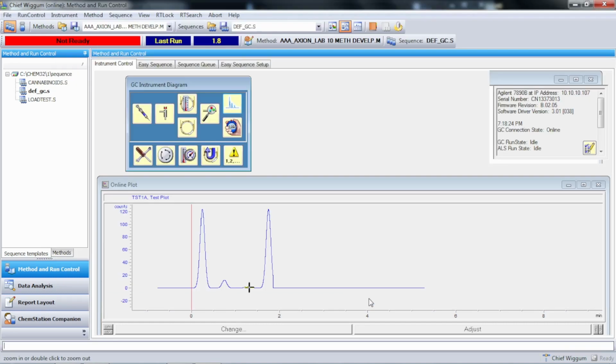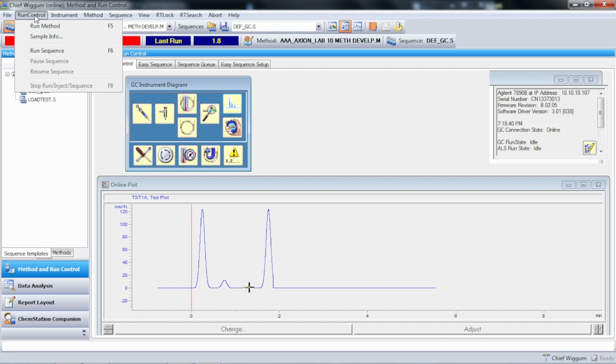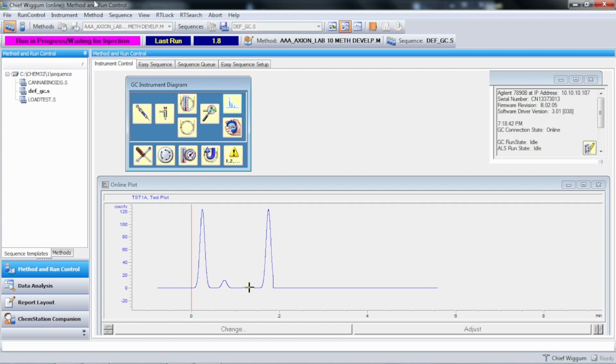Then when we say OK, so now anytime we hit the start button on the GC, it's going to output this chromatogram. And this chromatogram contains 3 peaks, big, medium, and small. It takes 1.5 minutes, and then it keeps repeating itself. So I'm going to go up here and tell the instrument that I'm going to start the run. Now it's waiting for the start button.